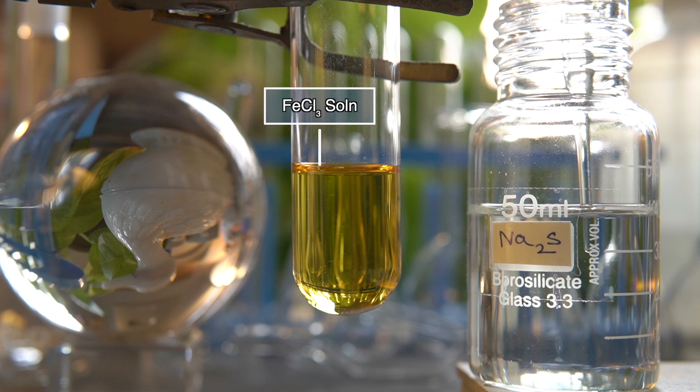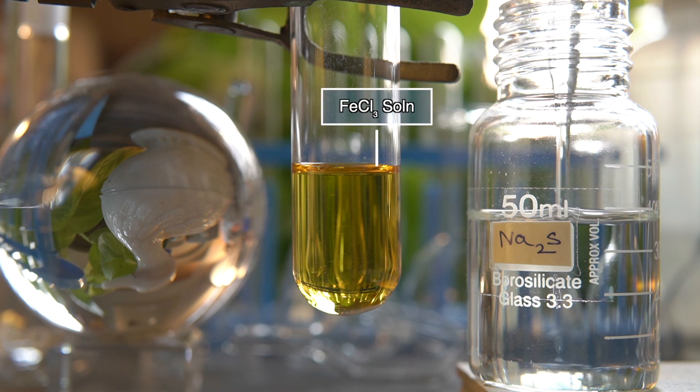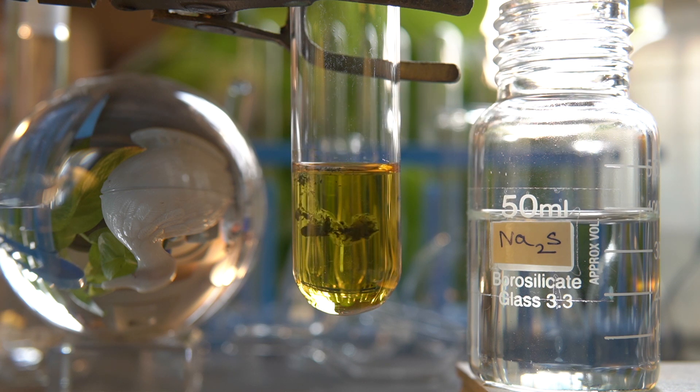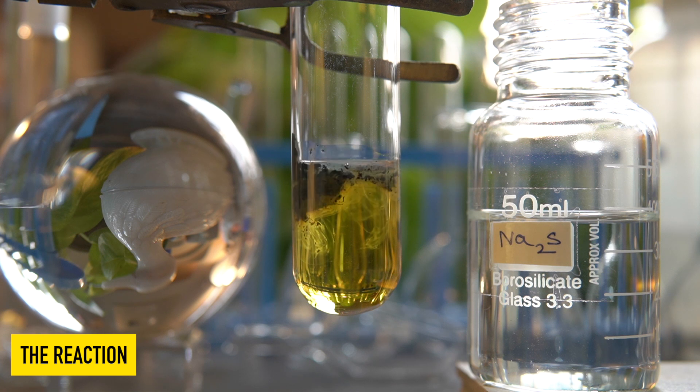Now we will add sodium sulfide solution into the iron 3 chloride solution dropwise and observe the effects.